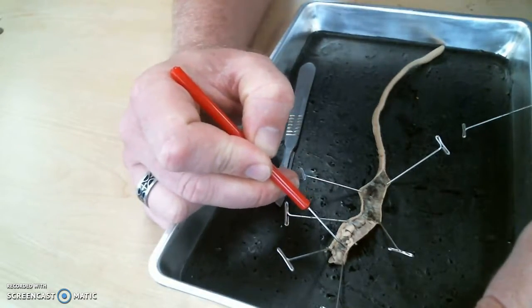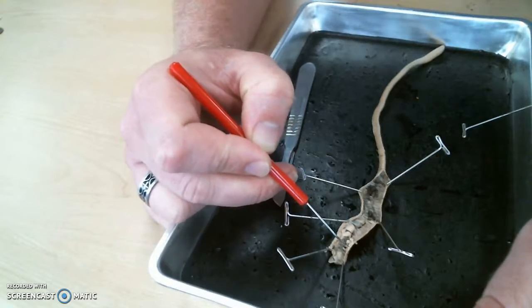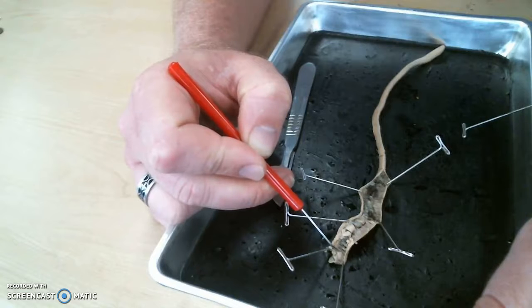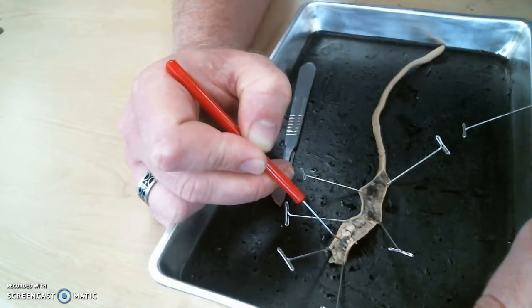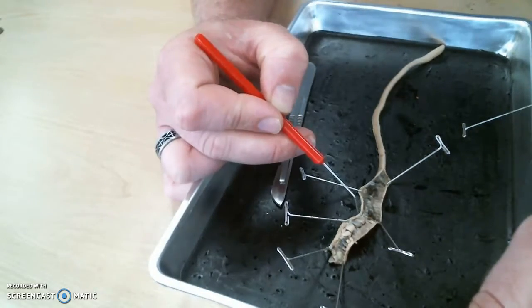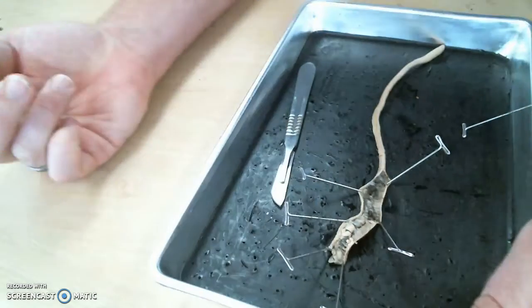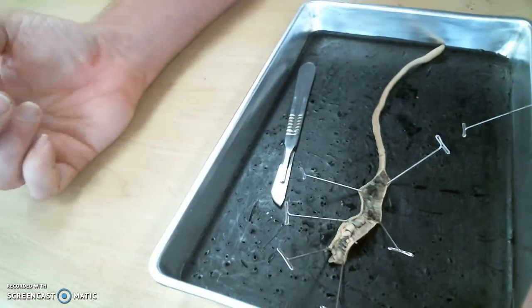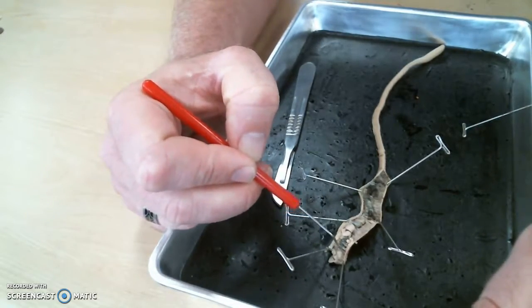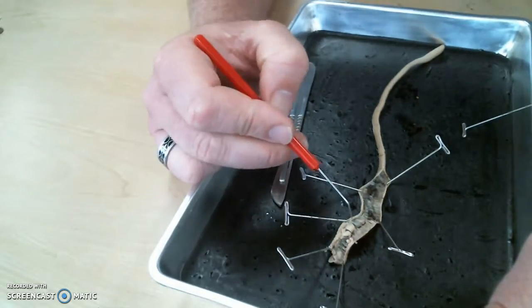There is a tube, and I don't want to disturb this tissue too much over here. There's a tube that goes from this beige structure through these black things, which we'll get to in a minute, underneath these white things that we'll get to in a minute, and ends up in this structure. What's the name of the tube that runs down through all of this? Esophagus. Good. It's called the same thing in you, right? Most animals have a tube after the mouth. We'll get to all of this stuff in a minute.